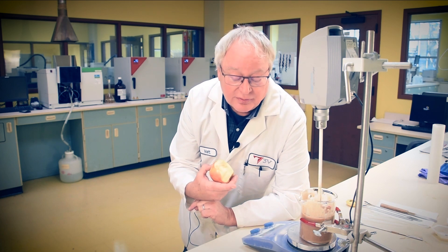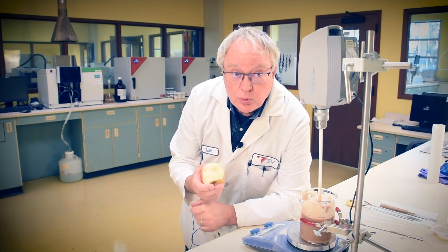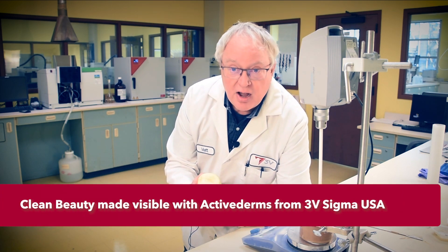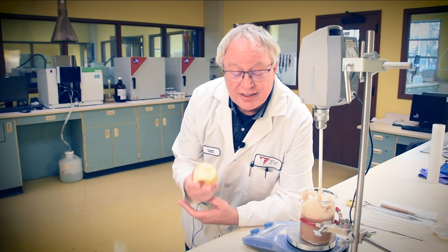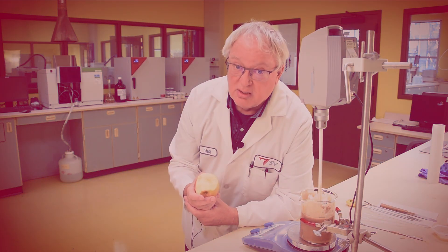As you can see, the two Active Derms convey a tan opacity to our body wash, which would otherwise be clear. That's a good quality for marketing to clean beauty consumers — they have verifiable evidence of the skincare ingredients comprised within. Now they cannot see the olive oil contribution; that's in the mixture of course. But they will feel it all the same when they use this cleanser.